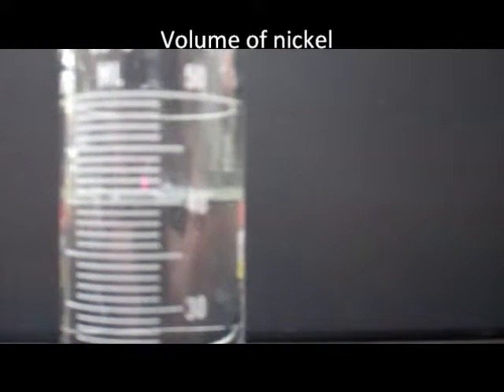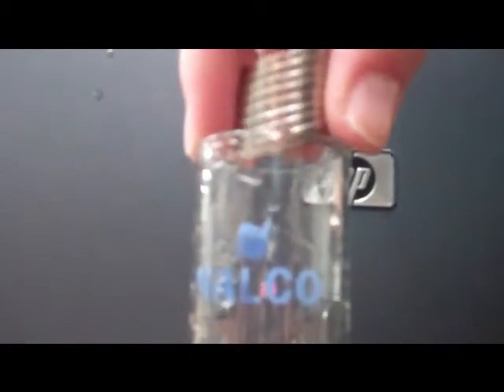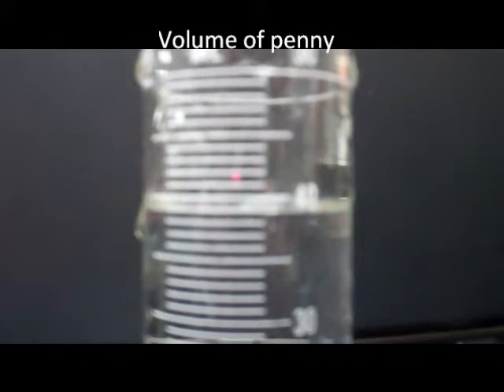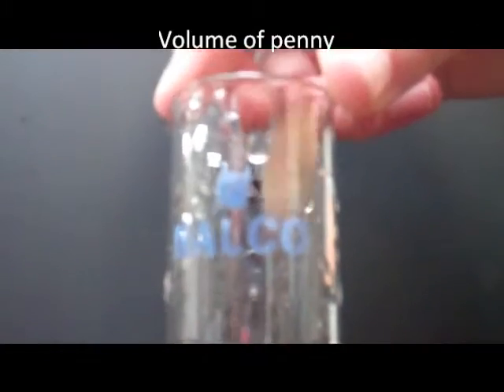For the nickels, I'm going to start with 40 milliliters of water. Now it's at 46.5 milliliters. For the pennies, I'm going to start with 39 milliliters of water. Now it's at 43 milliliters of water.